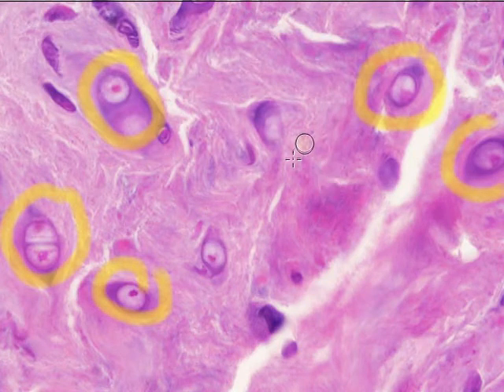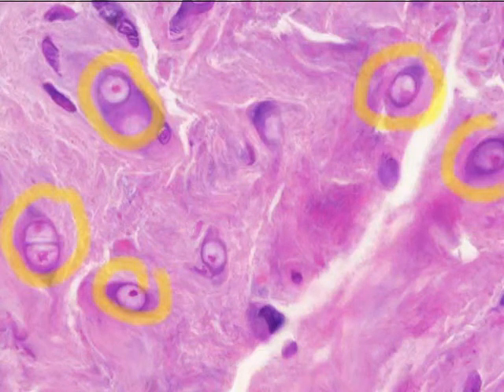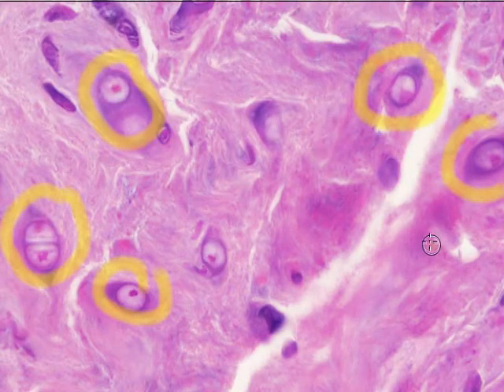It's very dense. It almost looks like dense irregular connective tissue in a way, but that tissue does not have these larger chondrocytes and these very prominent lacunae spaces. Remember, we couldn't see a whole lot of cellular detail at all in the dense irregular connective tissue. Well, you can see the fibers, how kind of stringy, especially here where it's a little lighter, how stringy and fibrous this cartilage is. And this is tough.